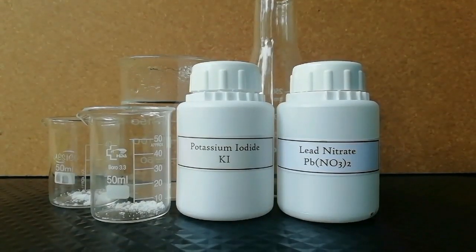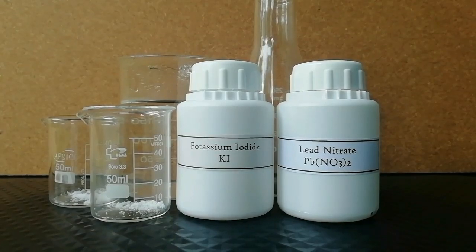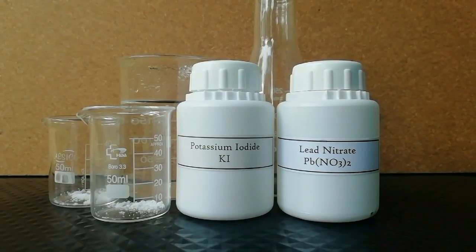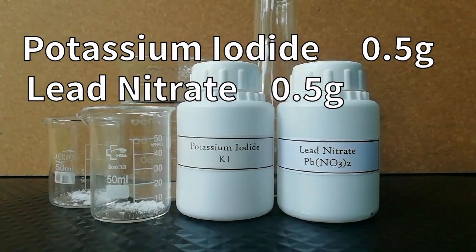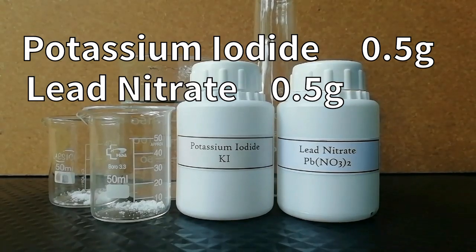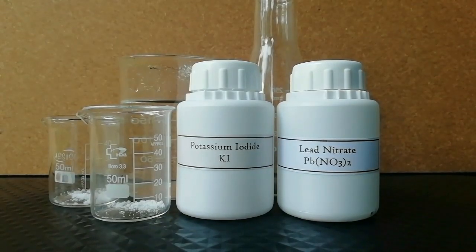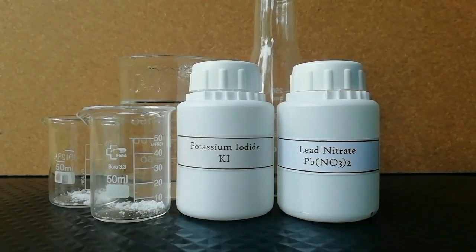For this reaction we need lead nitrate and potassium iodide. I weighed out 0.5 grams of each chemical.